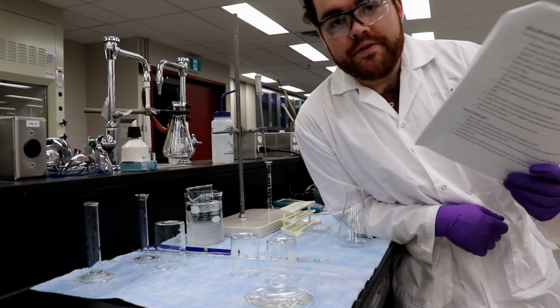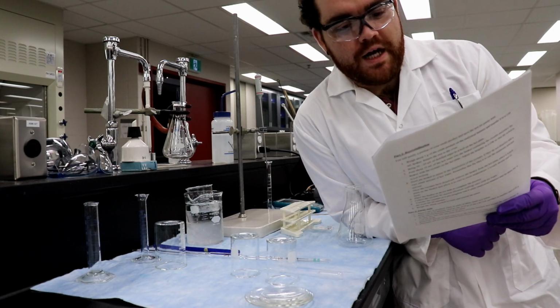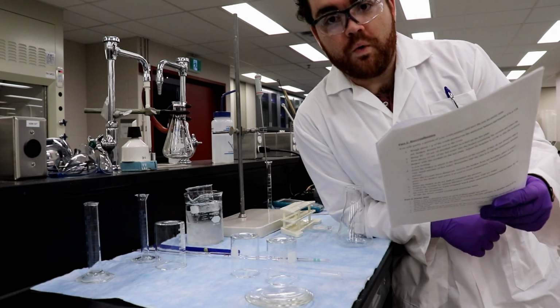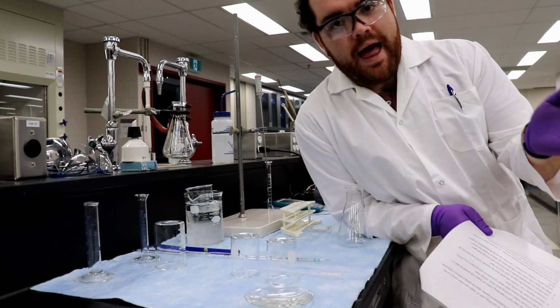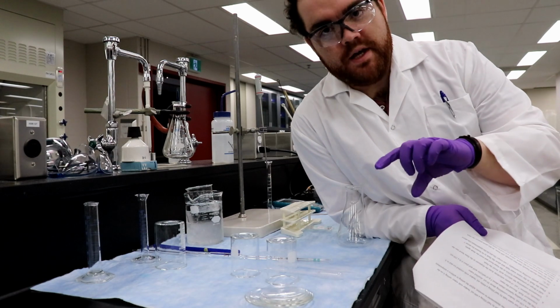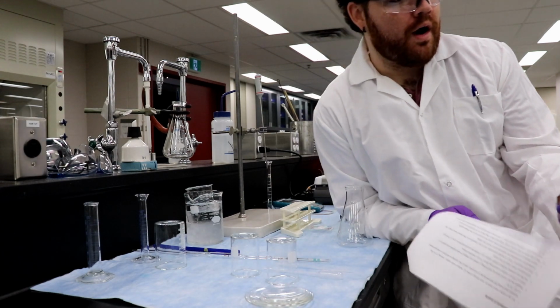On the top loading balance, for this we're going to use the analytical balance because we're just that cool. Obtain about 5 grams of salicylic acid and place in a 250 milliliter Erlenmeyer flask. Record the mass. So we're going to take a weigh boat. We're going to tare the weigh boat, add 5 grams to it, weigh that, transfer it to a beaker, and then weigh the weigh boat again to figure out what got stuck to the weigh boat, and then we're off to the races.